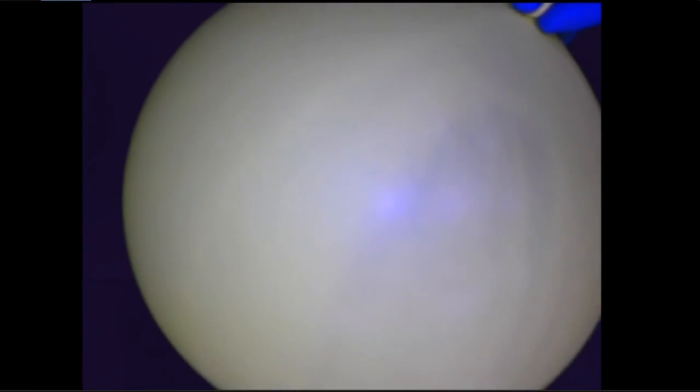And then as soon as we take it out, when the balloon can access the regular air temperature, it causes that liquid to then expand back into a gas, and you get back your balloon. Okay, so just a little example of gas laws, and in your write-up, you guys can try and determine which specific gas law governed this experiment.